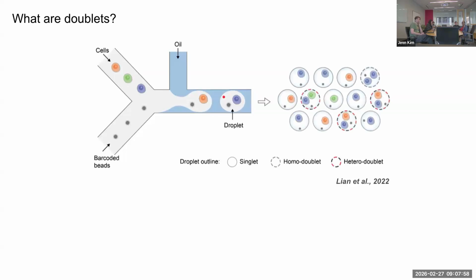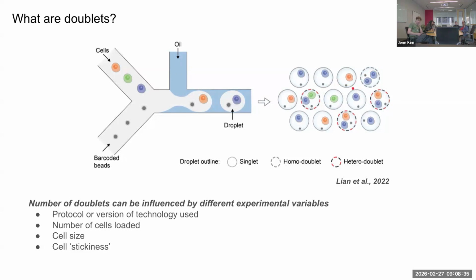So there's different flavors of doublets. So you can have cells of, for example, the same type. So these are called homotypic doublets, denoted by this gray dashed line. And then you can also have cells of different types in a doublet, or heterotypic doublets. And these homotypic doublets are usually not considered as much of an issue since they sort of mimic the transcriptome of a single larger cell of the same cell type and aren't really creating potential hybrid or fake cell types or new transcriptional clusters.